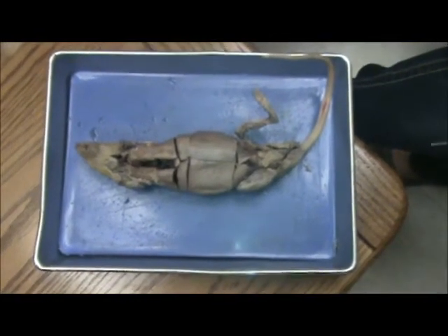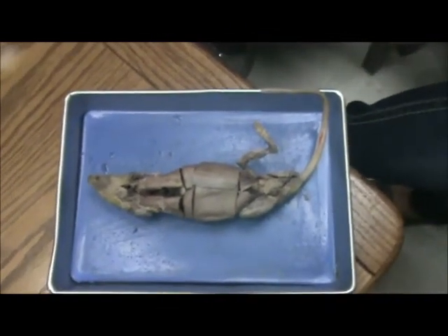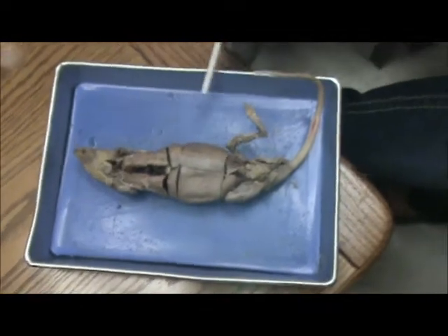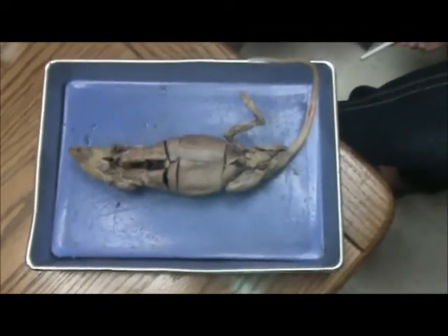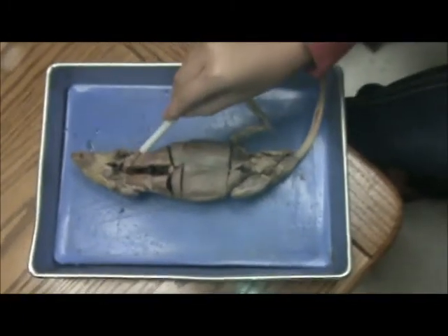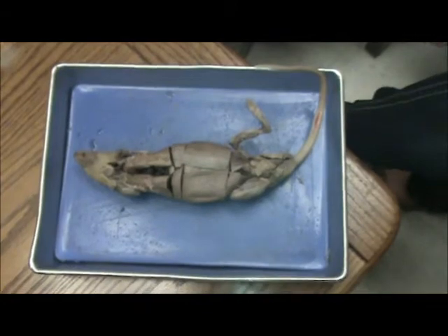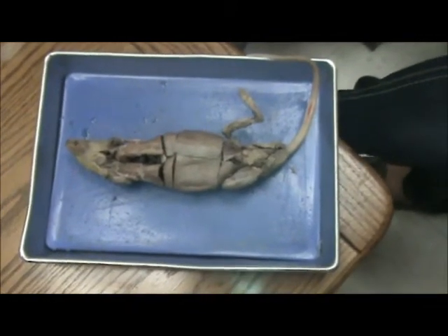When we first got Fernando to dissect him, we laid him supine, which means he's on his back, and we massaged his belly so that we could separate the skin from the muscle. And then we were able to cut his skin and take it all off. And then we cut him open, and here are his insides.